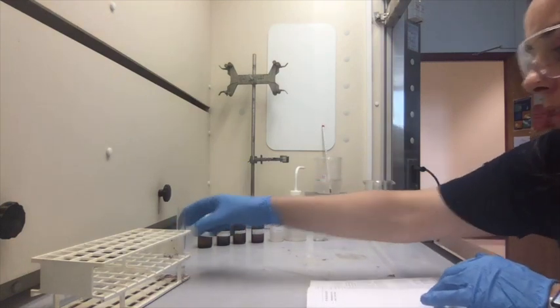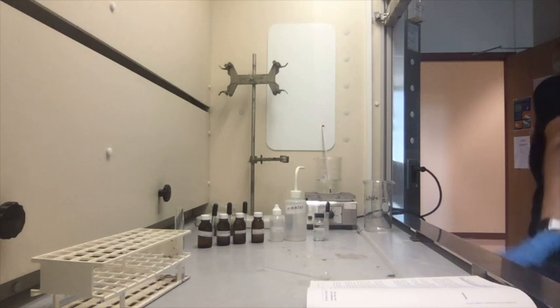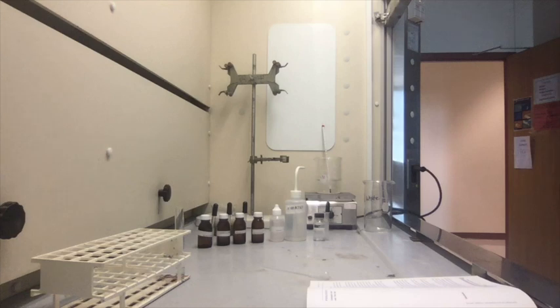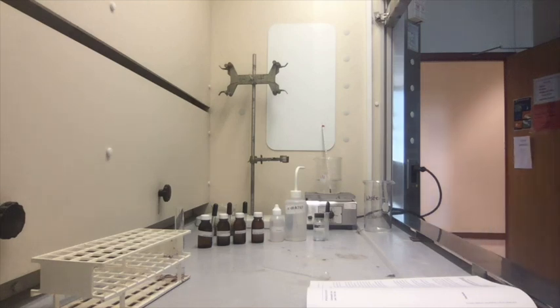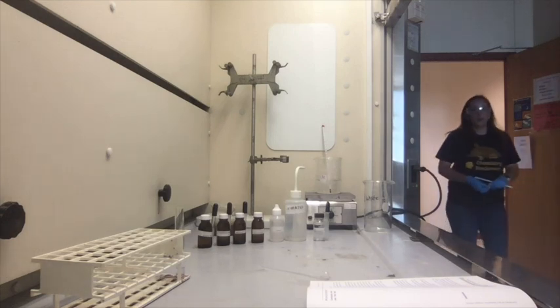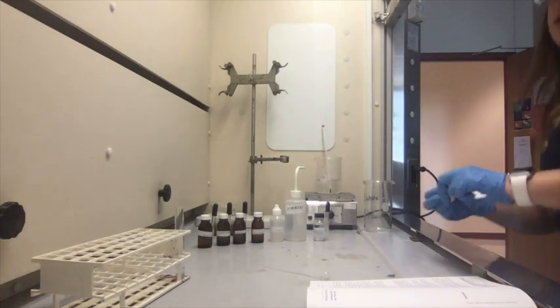So I'm going to go ahead and grab that. Alright, sorry about that. I thought I had already taken it out.